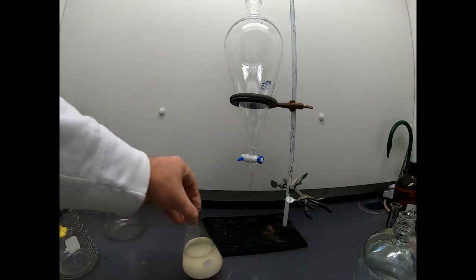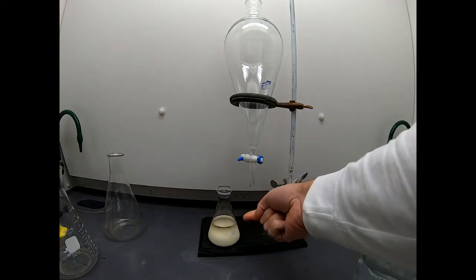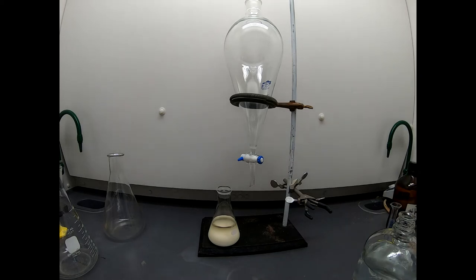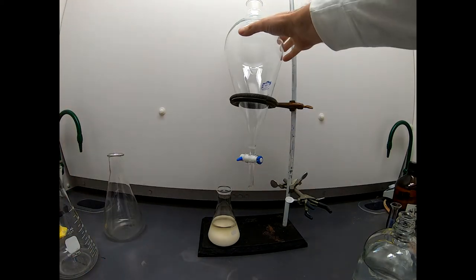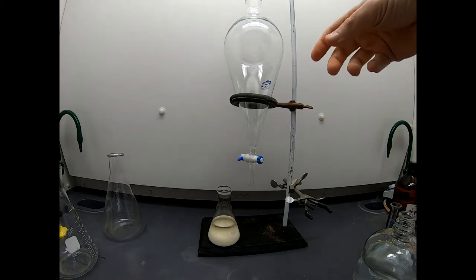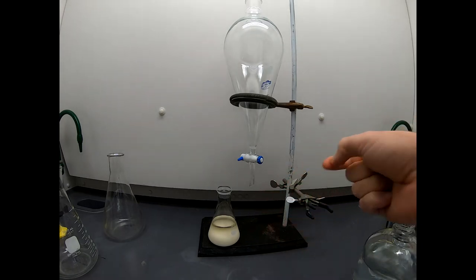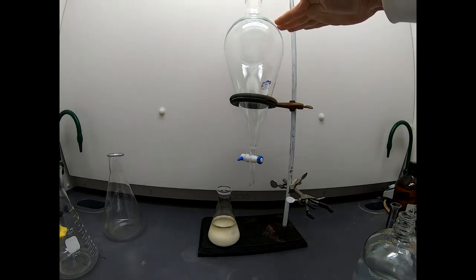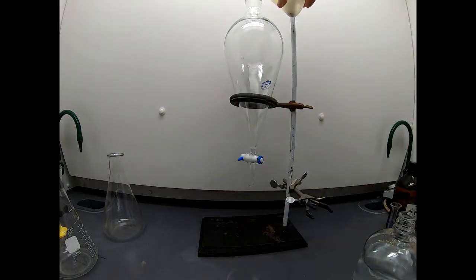Okay, this is going to be a lot of work. So be comfortable and we'll see how this goes. So we're going to do an extraction. We need to dilute this mixture, which is mostly DMF, into a mixture of ether and water. Now ether is less dense. It's going to float to the top and this is a big separatory funnel. So when we mix this with water and ether, everything in there is going to have to make a choice. Do the reagents in here want to go into ether or water? Our product is going to go into ether so it's going to float into the less dense layer. The other things like the salts and the DMF are going to go into the more dense aqueous layer.